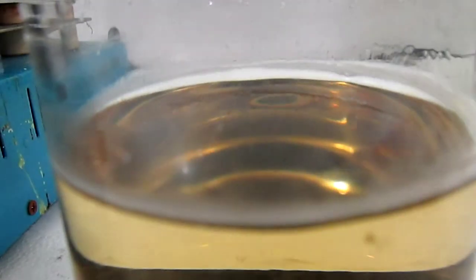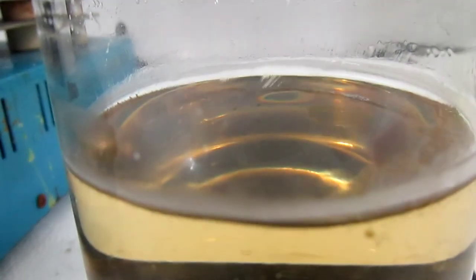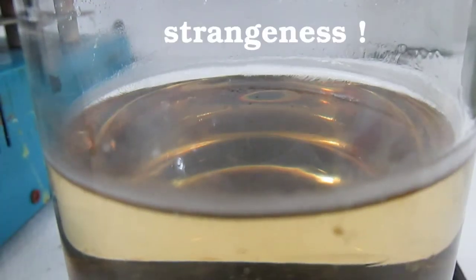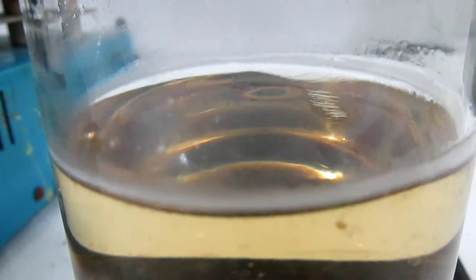With another batch of magnesium chloride, far dirtier this time, I appear to boil it down to a really really close point that of crystallization. Very interesting effects.